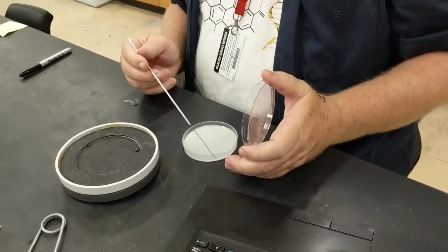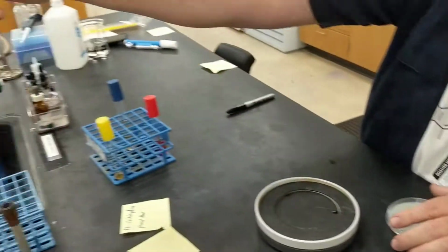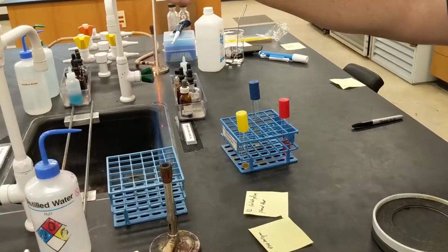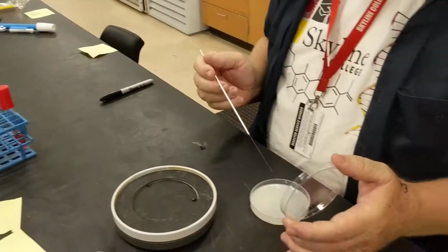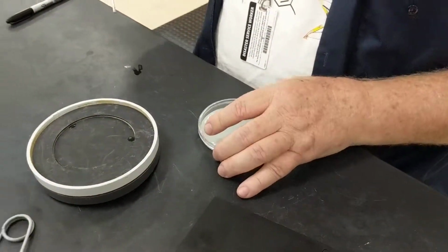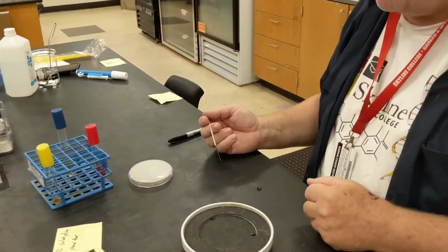That will tell you if you have any contamination, and that will also tell you what the activity of an individual colony would do. So after my streak, I would do the quadrant streak in order to get single colonies on there. If we go to the expense of producing a plate, you would always streak it out for single colonies. And then we'll take a look at that. So we're going from liquid culture to a plate.